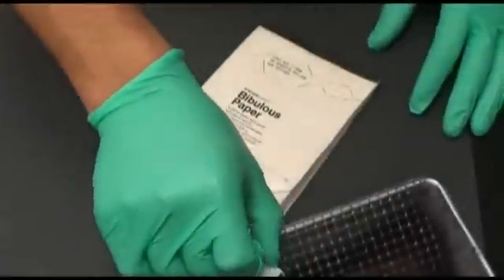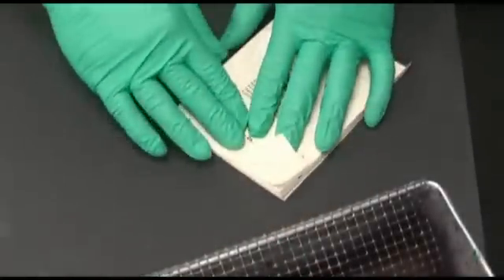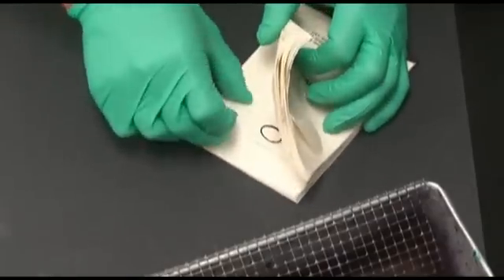Rinse thoroughly one more time and blot dry with bibulous paper. As shown here, using different sheets during the process will aid in rapid drying.